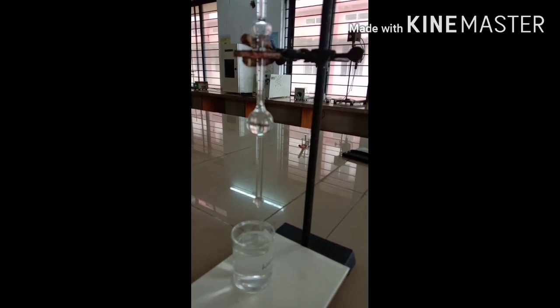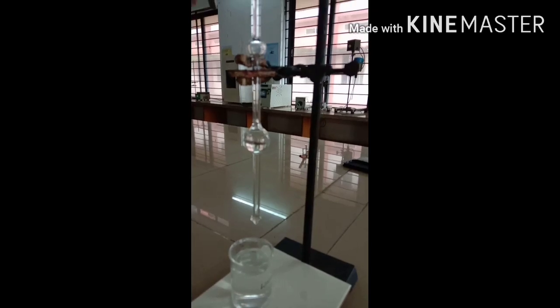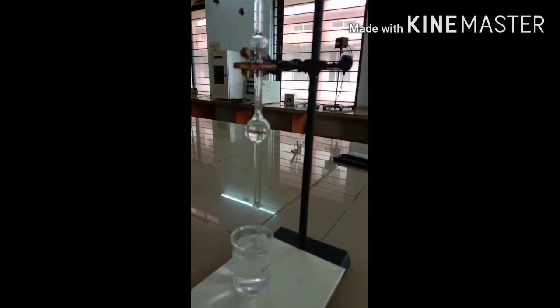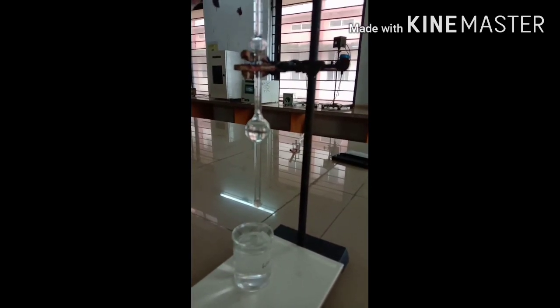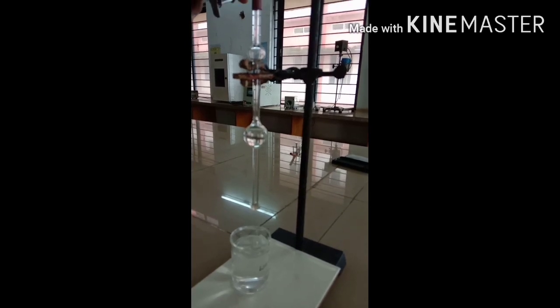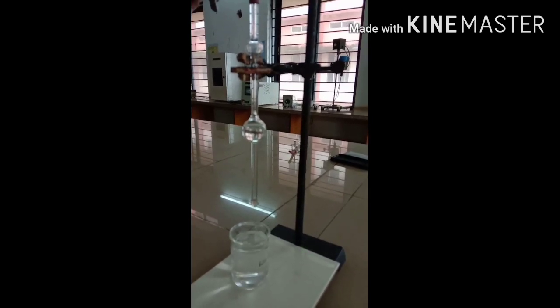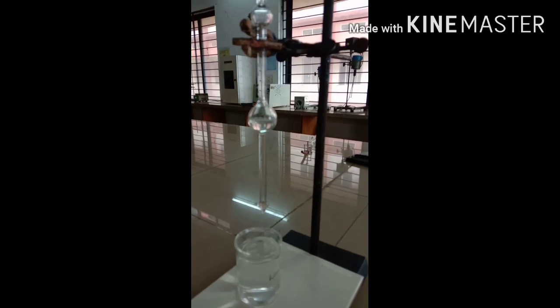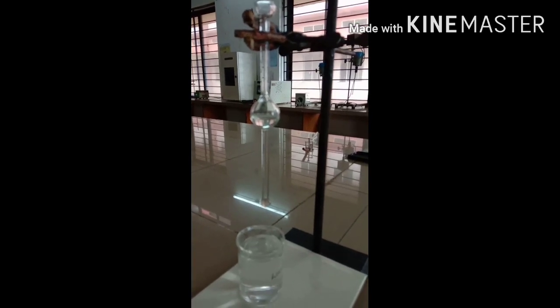Then when the water comes to the upper level, start counting: one, two, three, like so. It's a drop count method, that's why you have to count the drop from upper mark to lower mark, how many drops form.